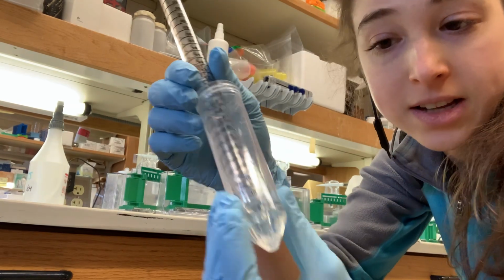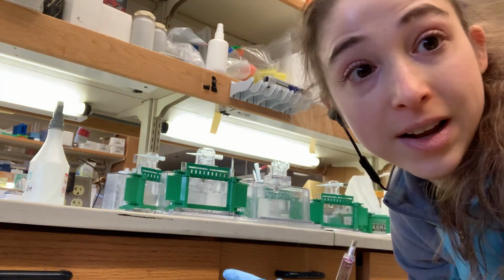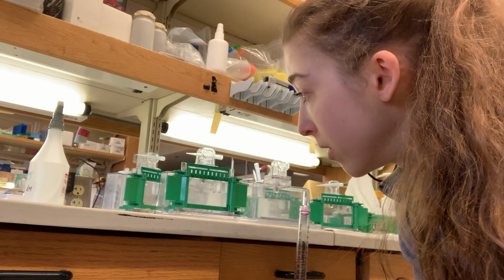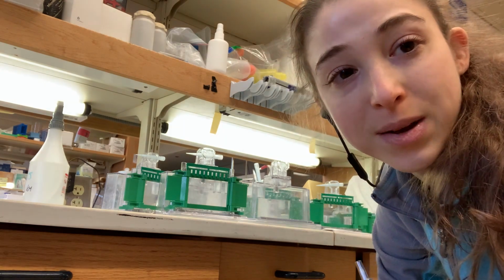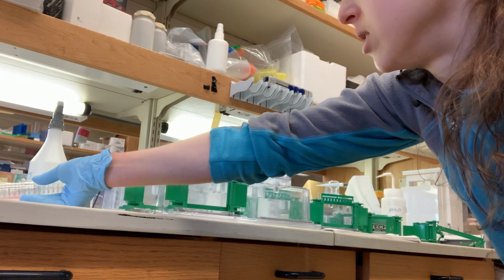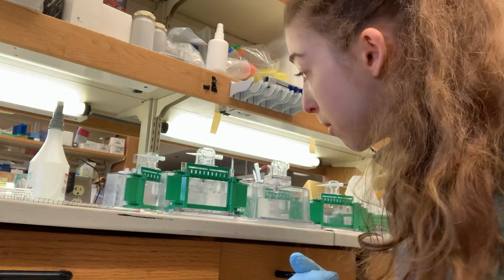The stacking gel has set, so the gels are done. They've actually been done for a while. I already took 4 and started those gels running, and now I'm going to wrap up the rest for later. I'll run the 5th one this morning, and hopefully I won't need to run the other ones, but it's nice to have backup. When you store them, you want to keep them from drying out. So I wrap them in wet paper towels and then saran wrap.